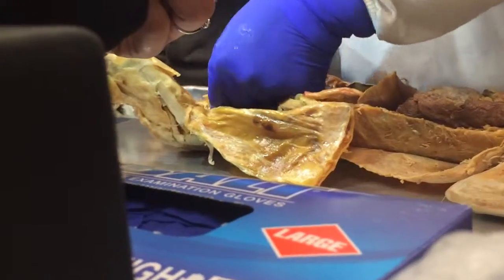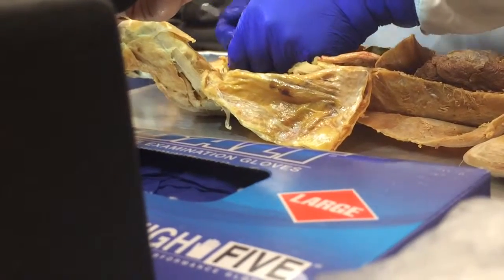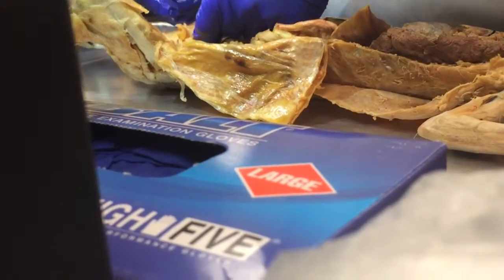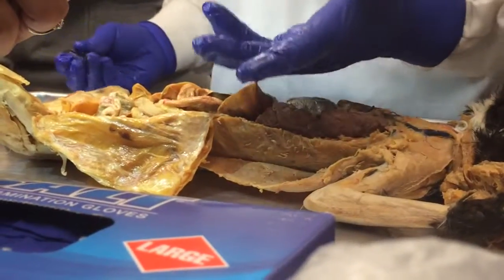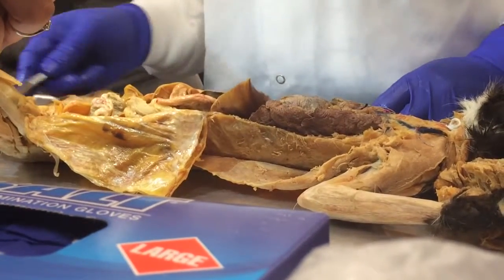Yeah. The other time there was a male cat, I squeezed the bladder like this and pee came out. It did. Gosh. Yeah, I could see a drop on the end of the penis. One of the cats I did, yeah.